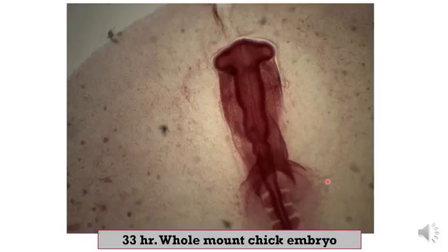Next slide, this slide is 33 hours, also a whole mount of the chick embryo. In this slide you can see more development, when the two limbs of the heart tube have fused forming a single heart tube.